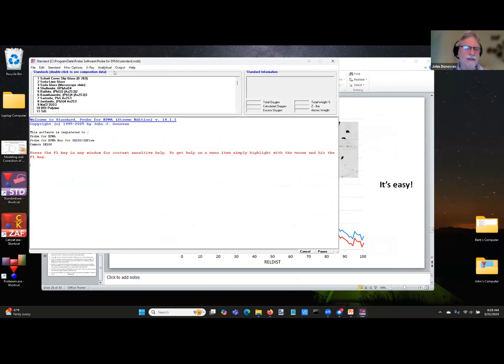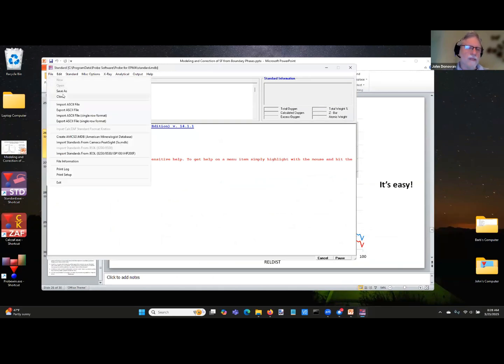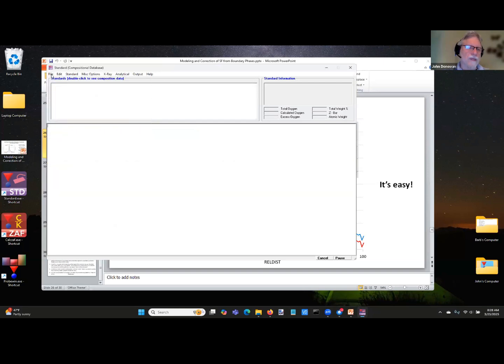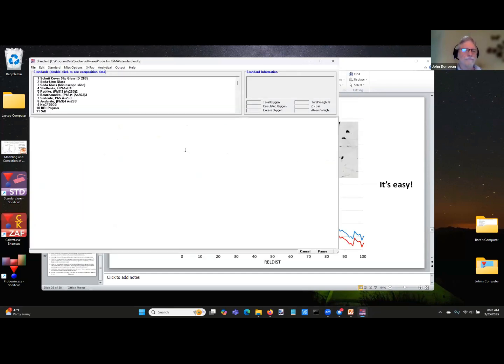You open up the standard and it opens up a default database. This database that comes with the software by default is actually my standard database. But you can create your own standard database, and of course you can close this and open a whole bunch of different databases. There's DHZ, there's Dana's, the American Mineralogist Crystal Structure Data Set, there's the ore minerals from Dana, there's the NIST database, there's a whole bunch of them, okay? But I'm just going to open the default one, because I know the numbers in it really well.